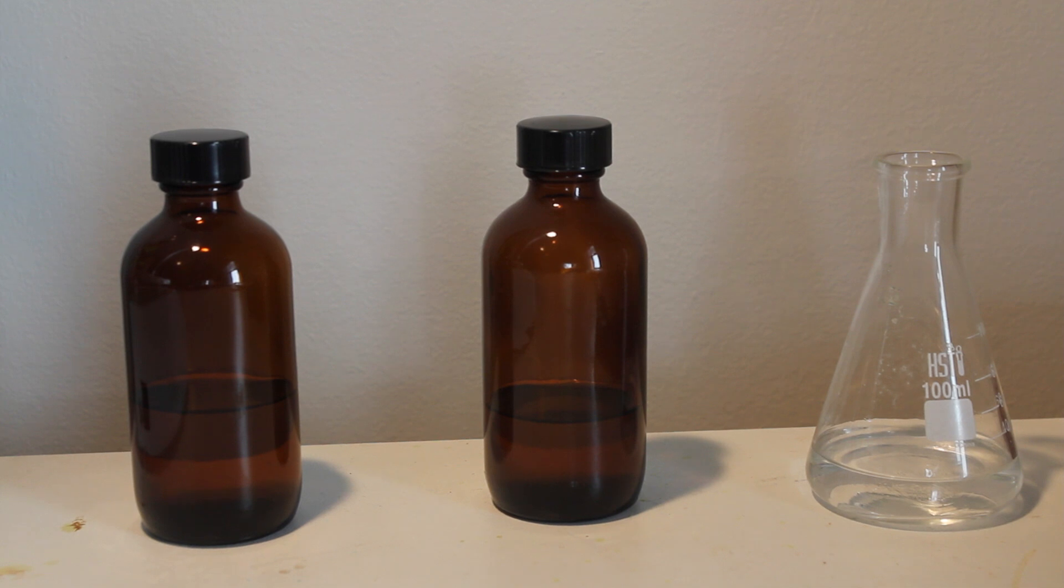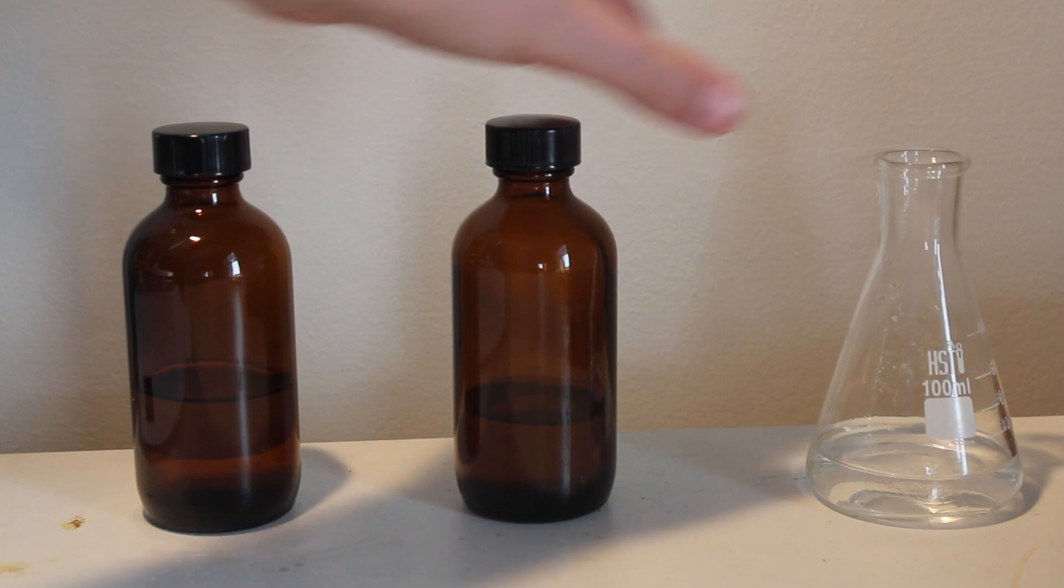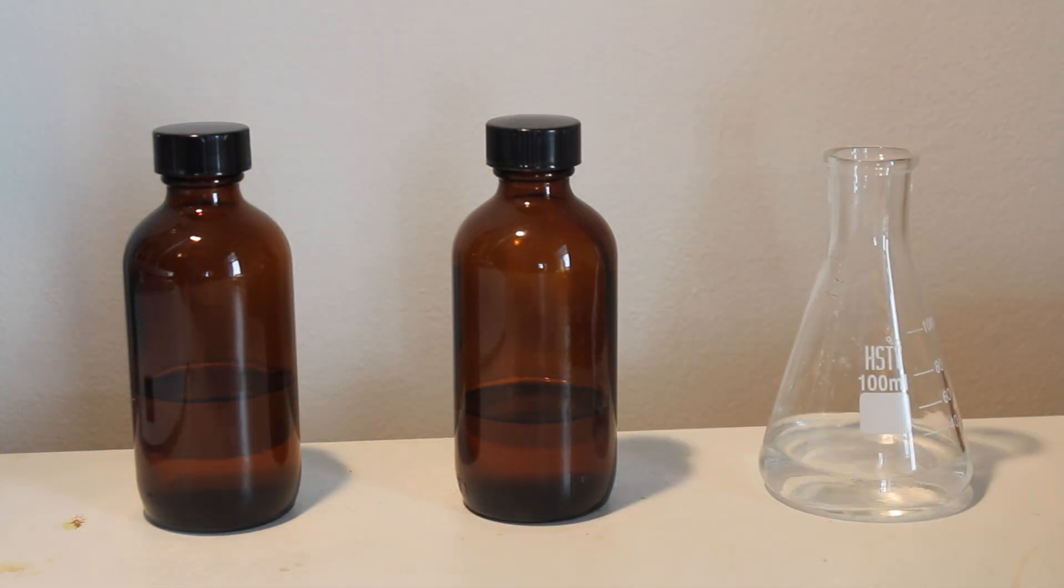Welcome to the Kemi-Kid. In this video we will isolate methanol, isopropanol, and ethylene glycol from antifreeze booster.